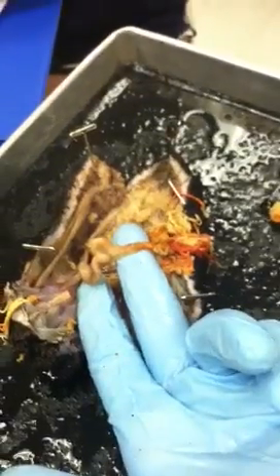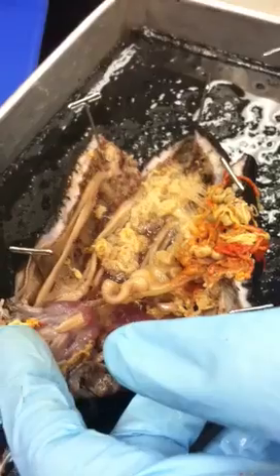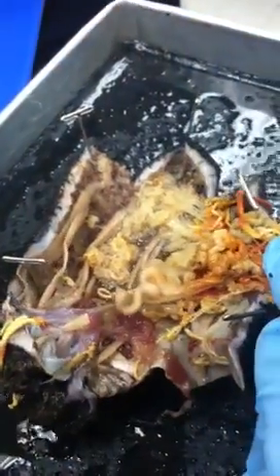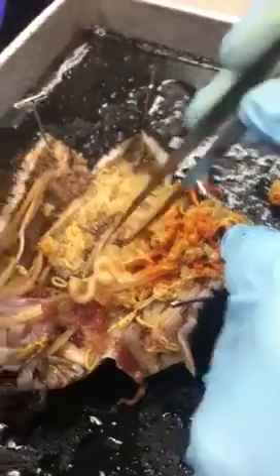Is it okay if we just draw a picture there and like that's the difference? Oh yeah. Okay. And the way that I would do it, if I'm asking you the stomach, it's going to be closer to the pharynx, and if I'm asking the intestine, it's going to be back here. So just stomach, intestine. Right. Stomach, intestines. So all of this stuff back here is all intestines. Okay. All this. Wow.